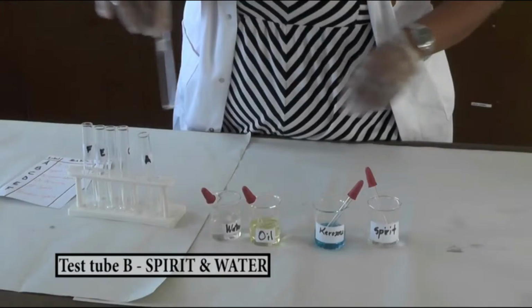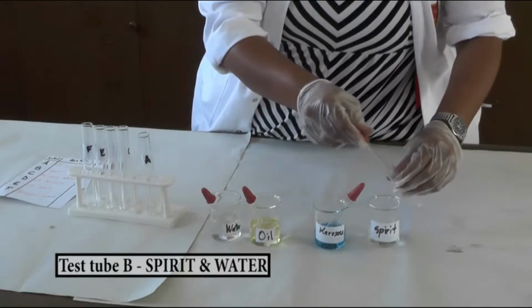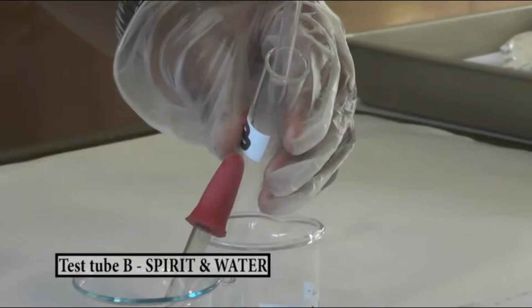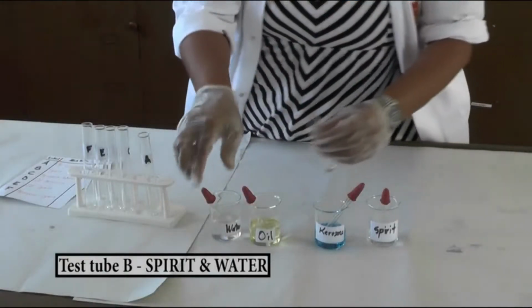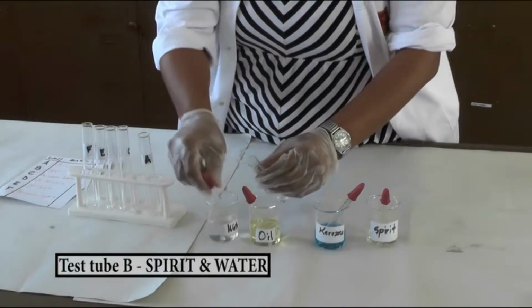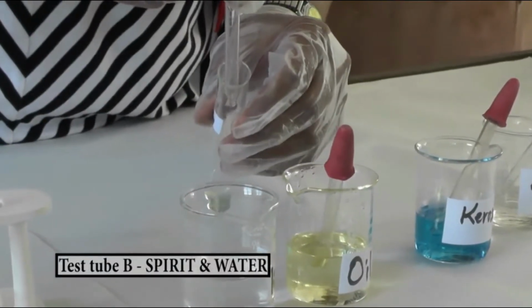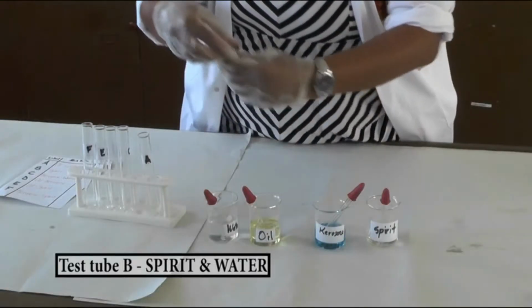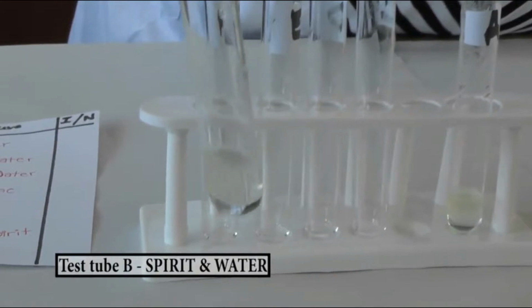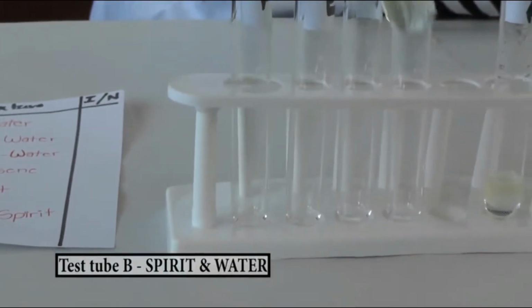For test tube B, add methylated spirit and water and mix them well. After mixing, put the test tube back on the rack.